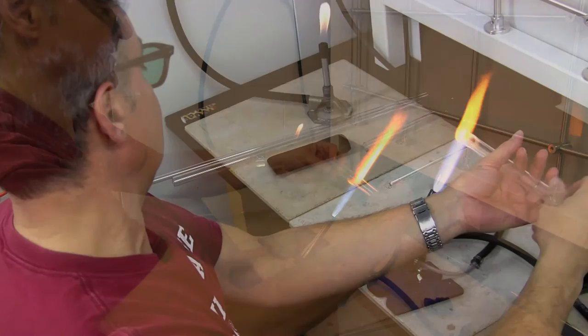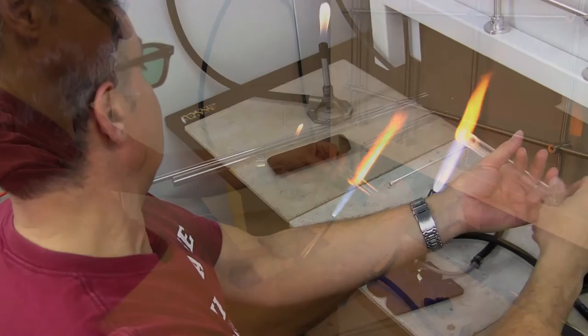The trick of working with glass is patience and always continuous rotation when we work with pipes and flasks to make even heating. Patience, no magic.